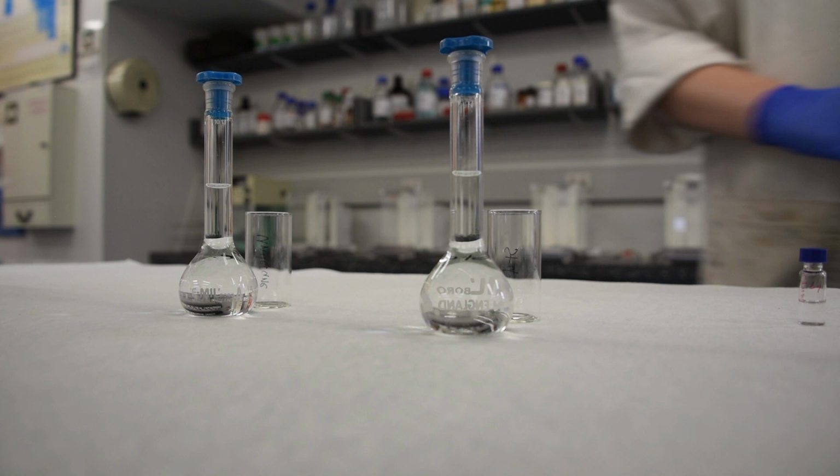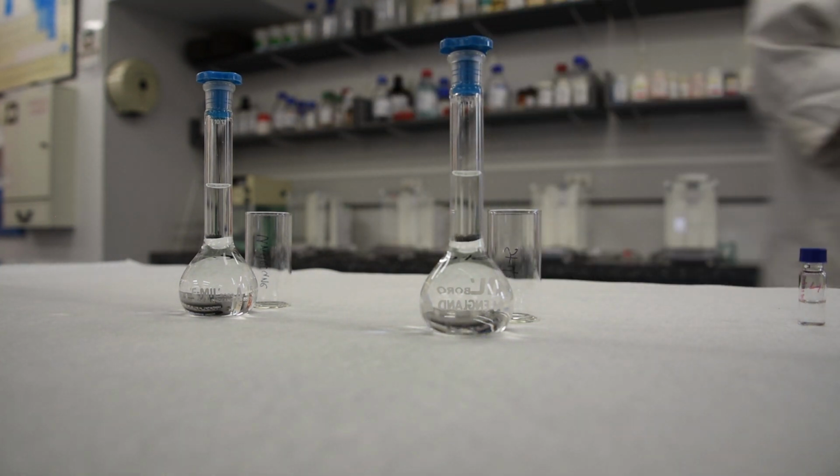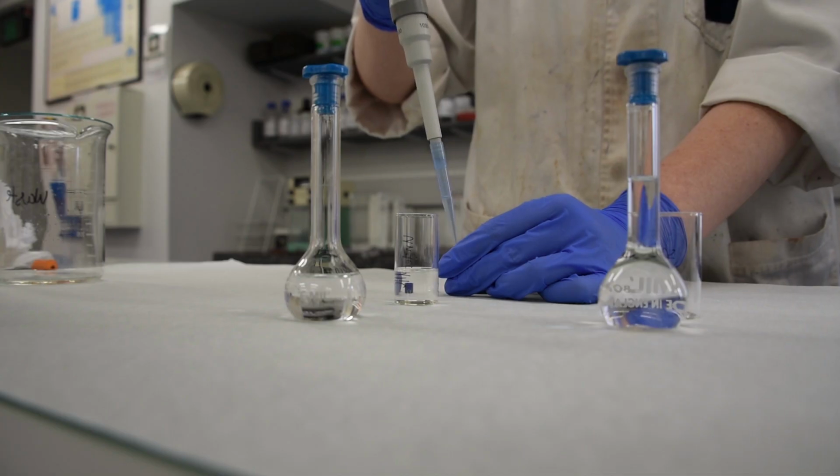The flask with the undecane is used as an internal standard in the analysis, as undecane is similar to the compounds of interest and is not present in the mixture being analysed. The flask with the 3 compounds is the standard to be used in the analysis.